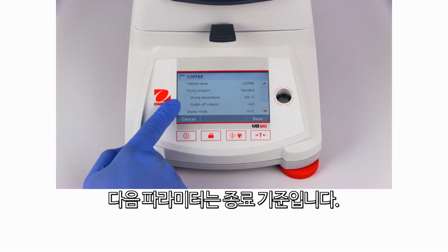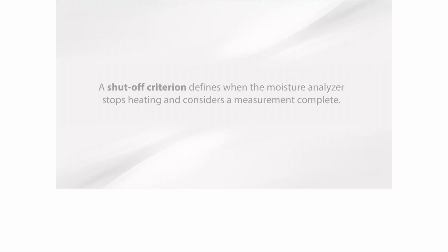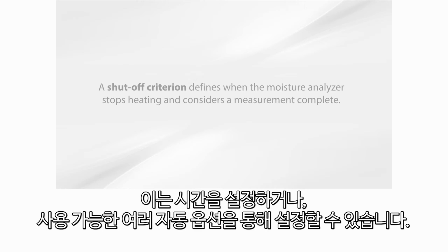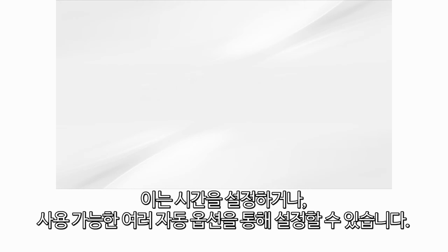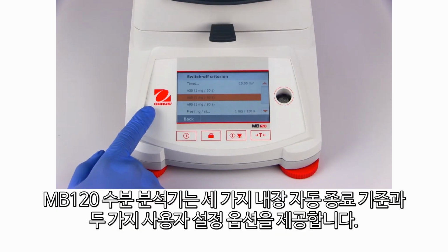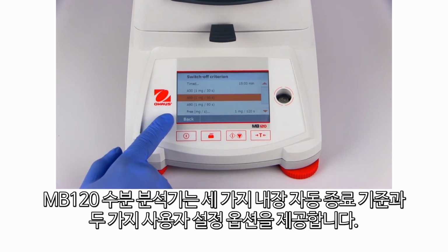The next parameter is to set the shutoff criterion. A shutoff criterion defines when the moisture analyzer stops heating and considers a measurement complete. This can be done by defining a time or via several automatic options that are available. The MB120 moisture analyzer offers 3 built-in automatic shutoff criteria and 2 user configurable options.